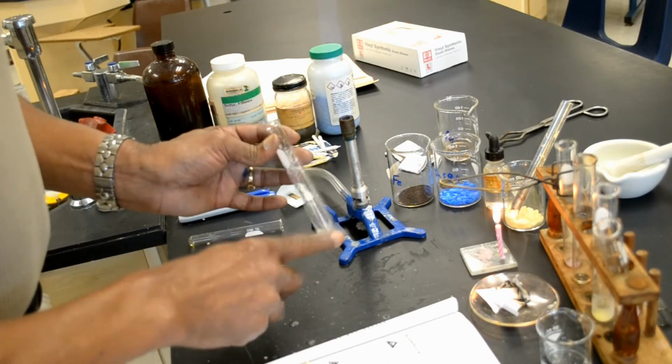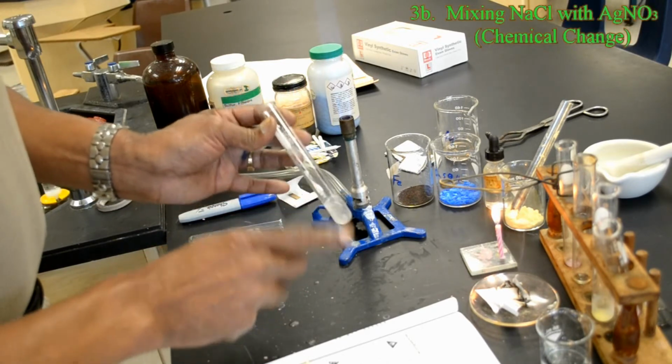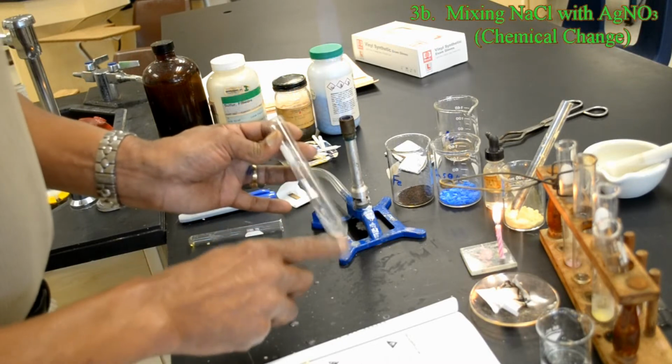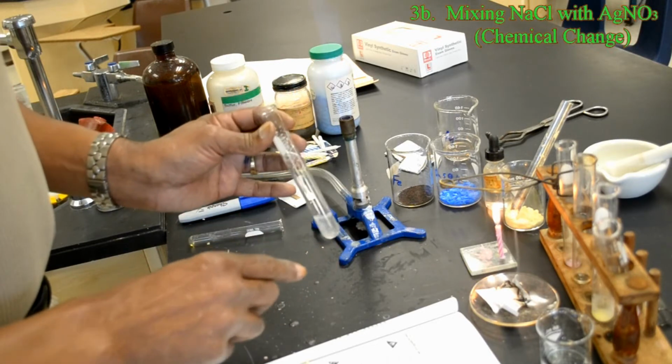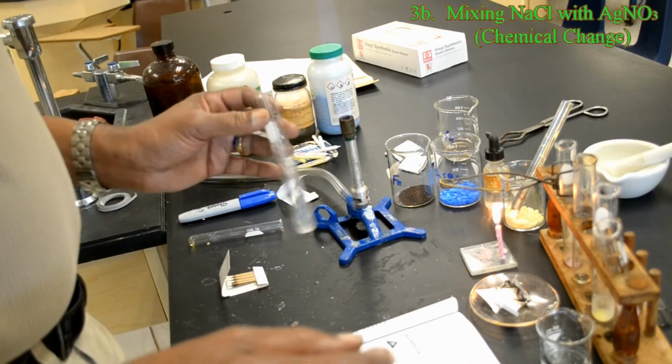Shake the contents of the tube. Next, use a dropper to add about 10 drops of AgNO3, silver nitrate, to the sodium chloride water mixture.